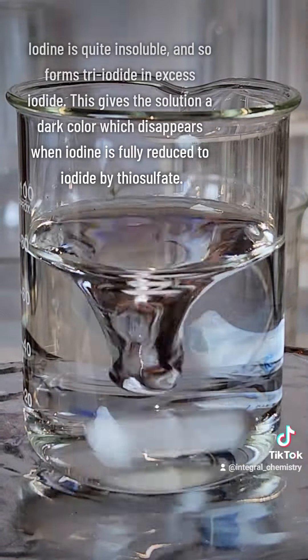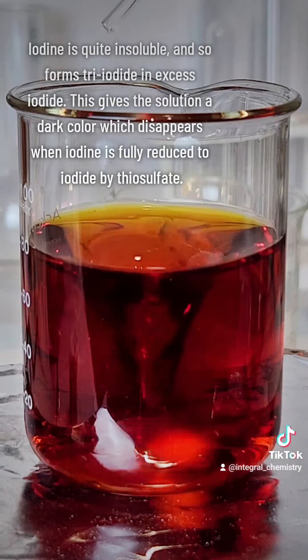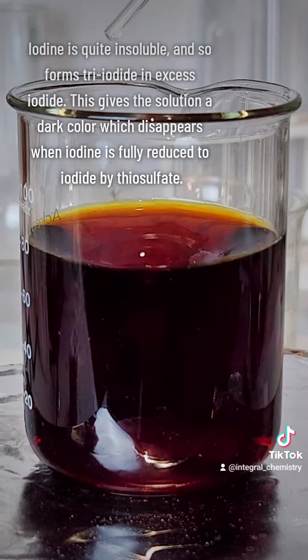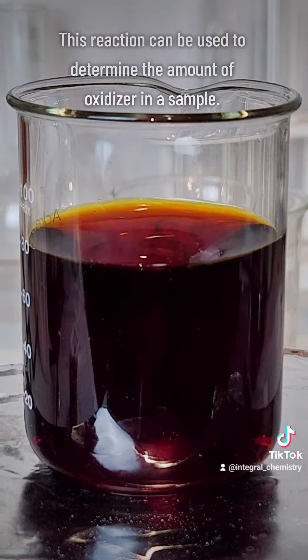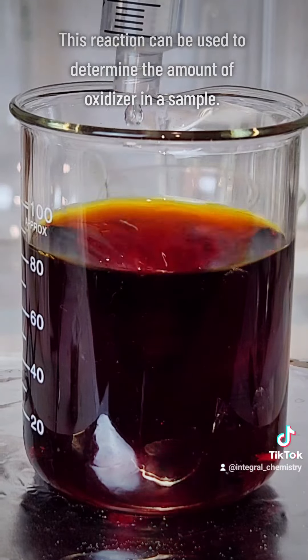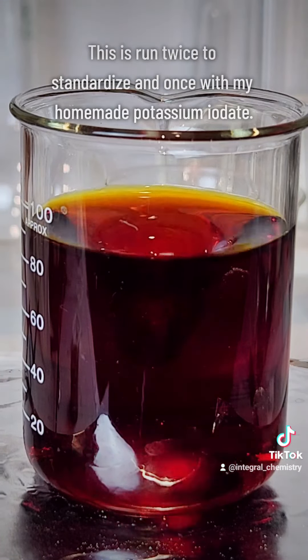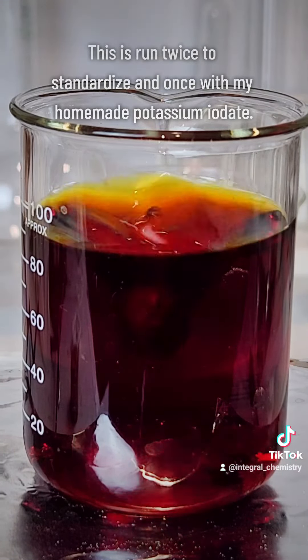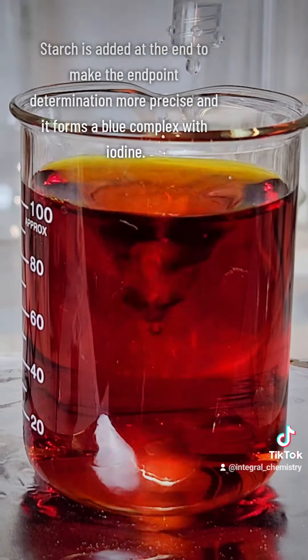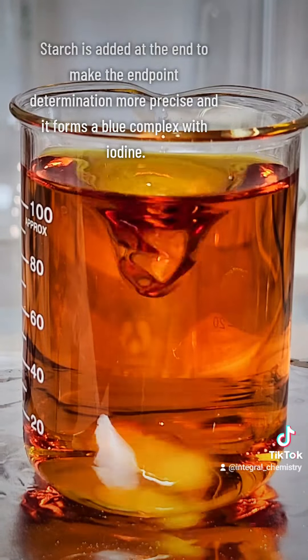The idea here is that when you acidify a solution of iodate and iodide, you get iodine, which is really insoluble in solution and binds with excess iodide to form triiodide ions. The mixture is then titrated with thiosulfate, and this reduces the iodine back to iodide, and as that happens, the solution clears up.